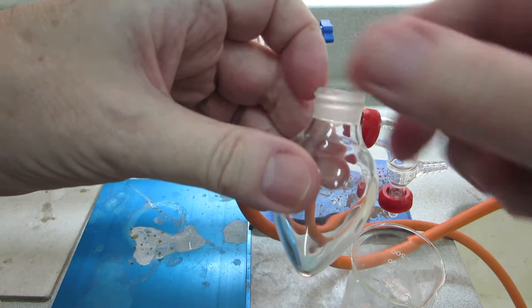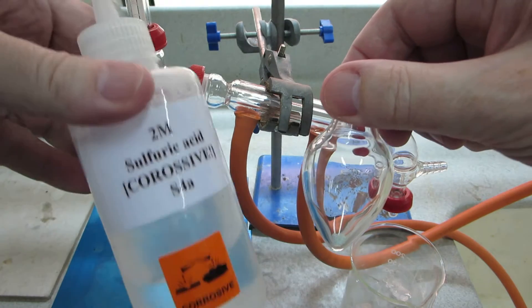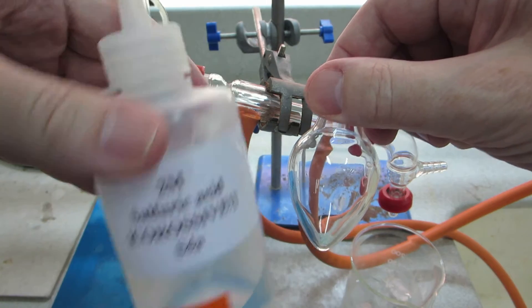We dissolve that into about half a ml to a ml of 2 molar sulfuric acid.